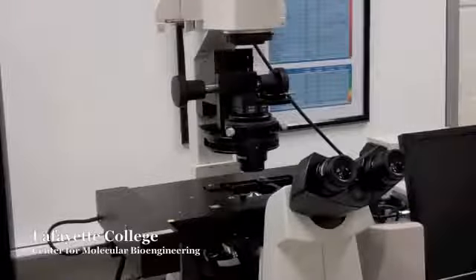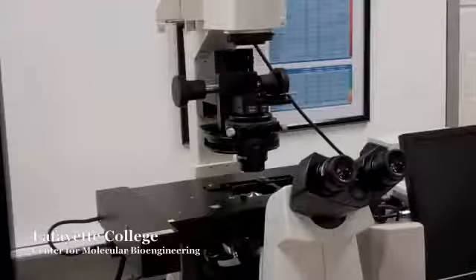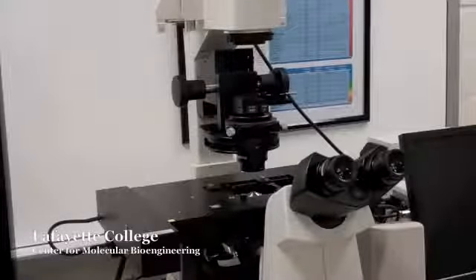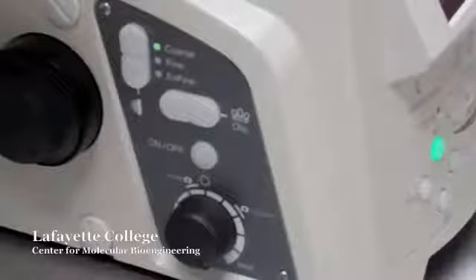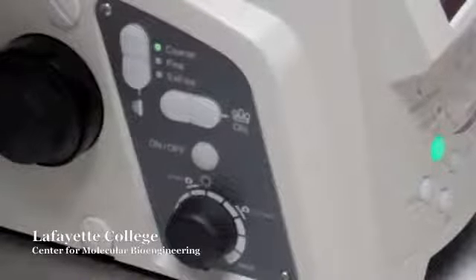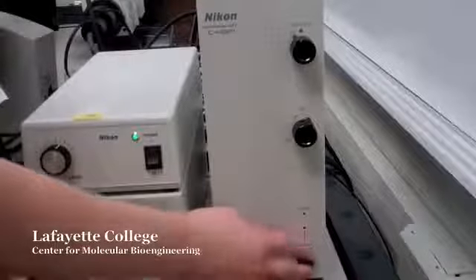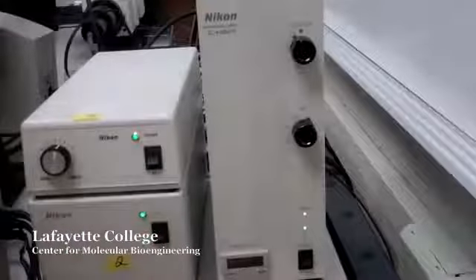Before optically focusing a fluorescence image on the confocal microscope, you need to focus the image using transmitted light first. To learn how to do this, refer to the video on optical imaging. Once the sample is focused, turn off the transmitted light using the off button to the left side of the microscope. Switch the power supply for the mercury light, labeled Intensilight, to the on position.